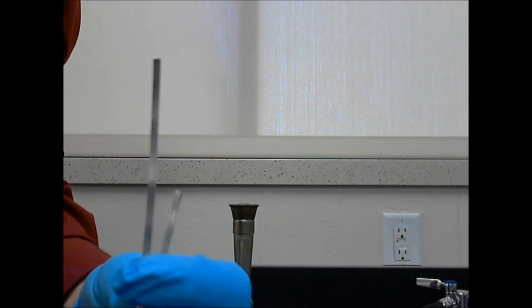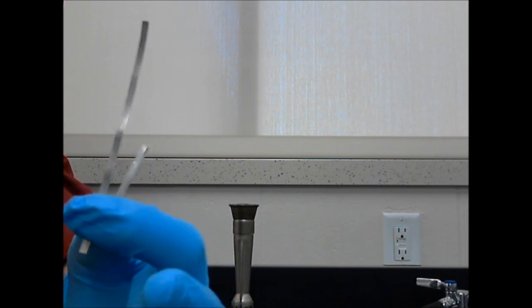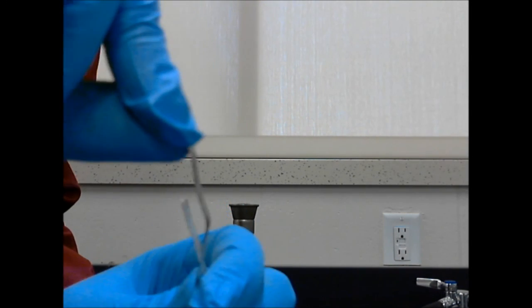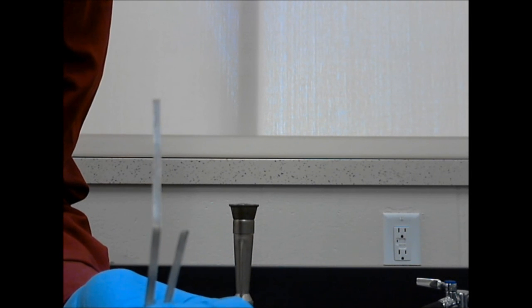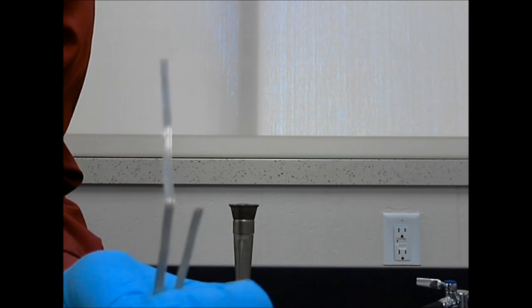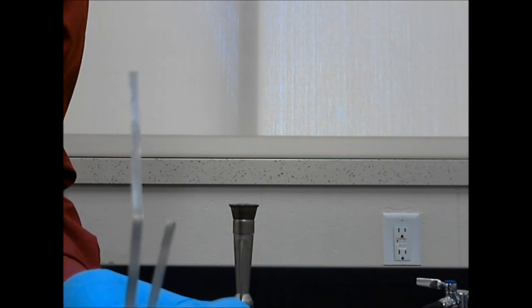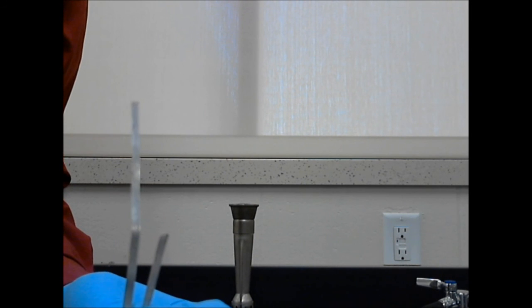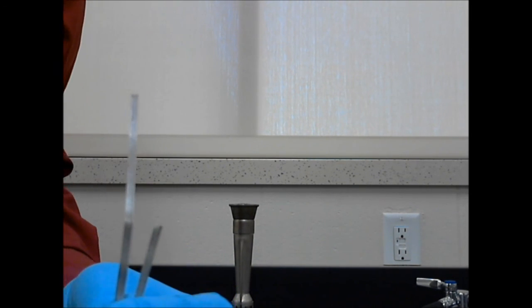This is magnesium metal. Now, magnesium metal is exactly like you would expect a metal to be. It's shiny, it's bendable, which means that it's malleable. It's much harder than sodium metal was. There's no way that I could cut this with a butter knife, but it is very reactive. Now, it's not nearly as reactive as sodium metal. I don't have to worry about this corroding in the air. It's stored in just a plastic baggie, not all the safeguards that sodium had.